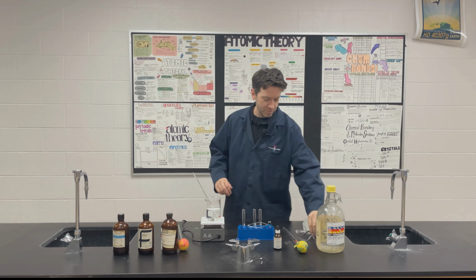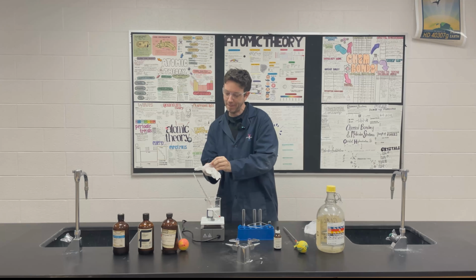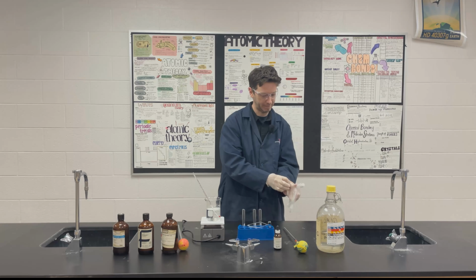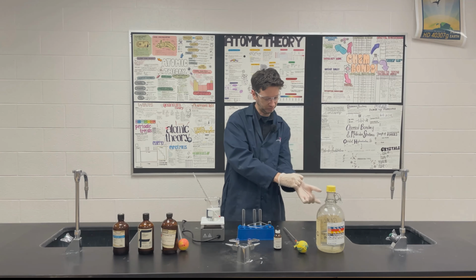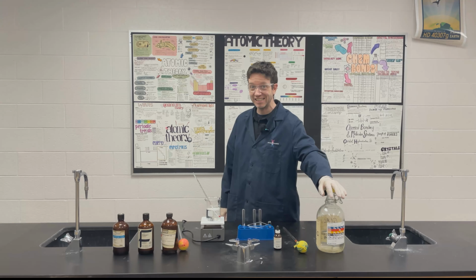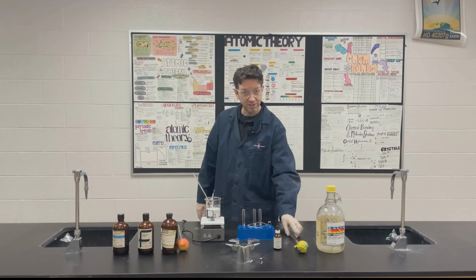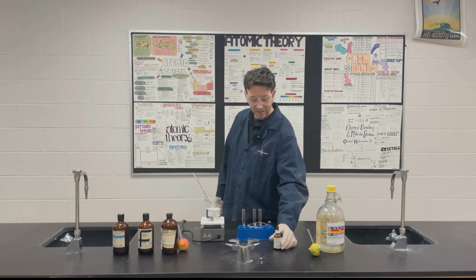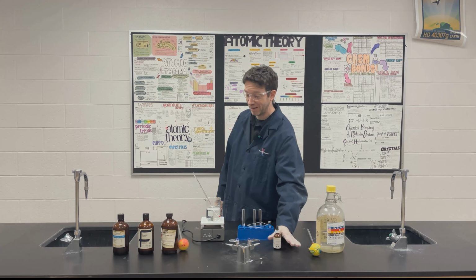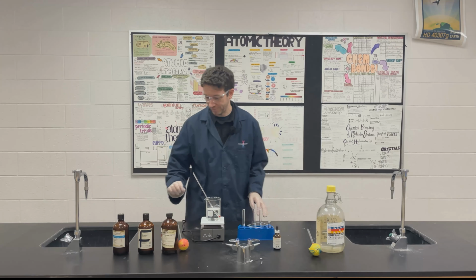All right, so here's the equipment we're using for safety: goggles and gloves. This is our organic acid, which is glacial acetic acid, so it's highly concentrated ethanoic acid. And we're going to use a pipette with that. Here we have our catalyst for the reaction. It's 18 molar sulfuric acid, so that one's very dangerous. I don't let my students handle that one. I usually put it in for them.